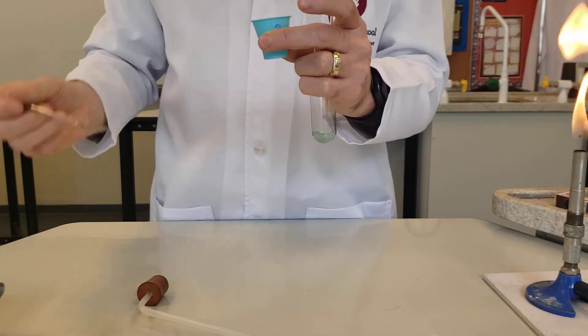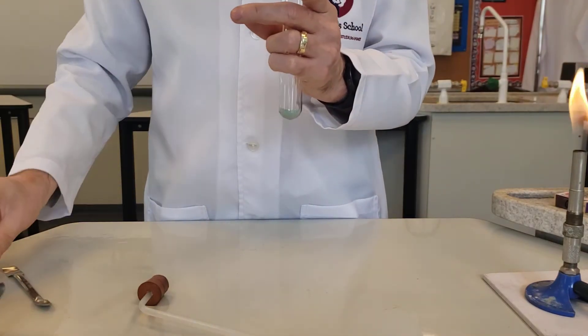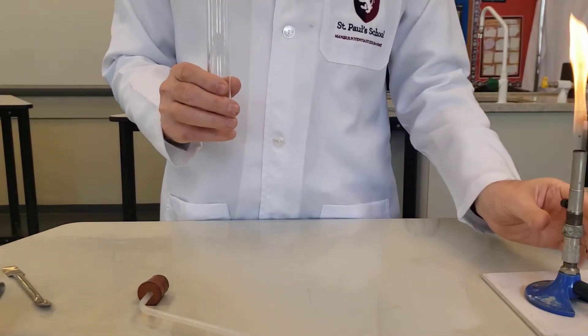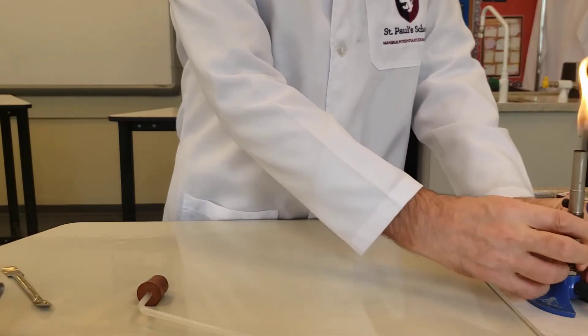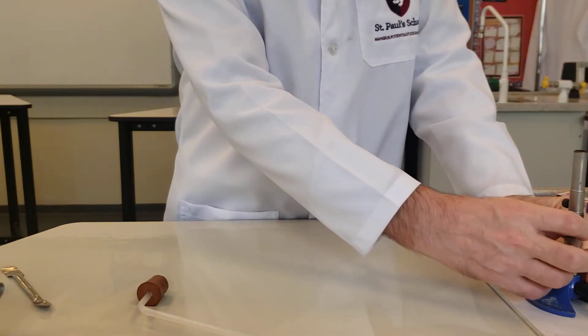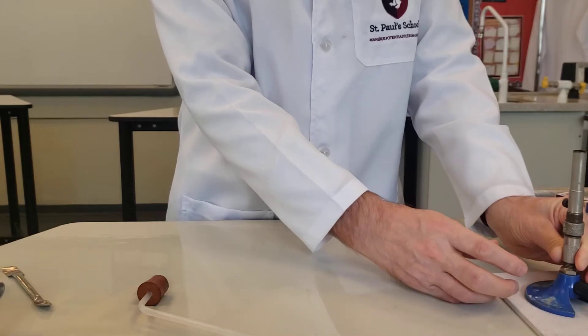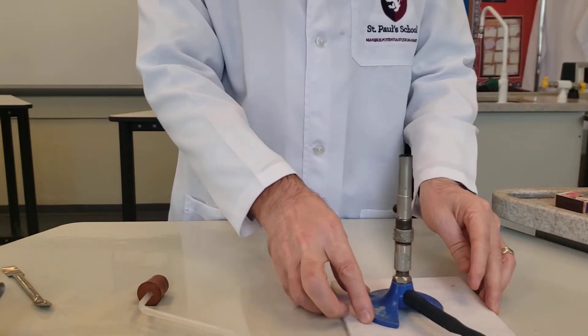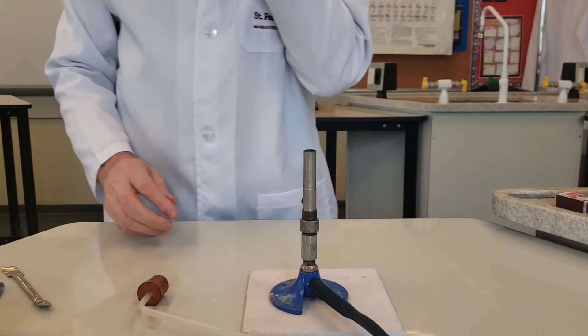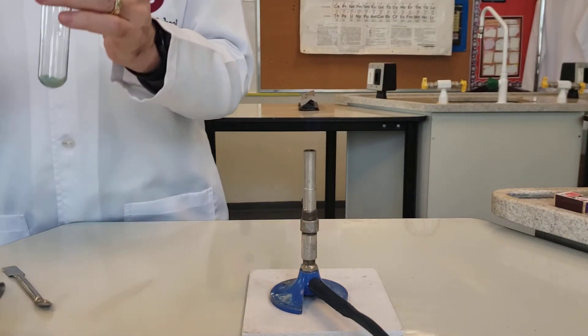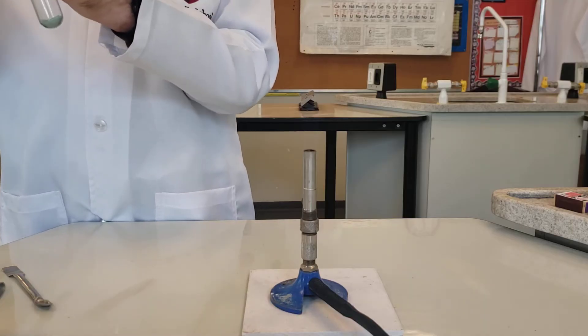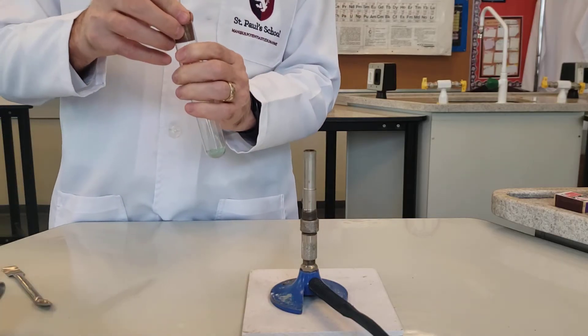And I'm going to heat it gently in a small blue Bunsen flame. So gentle heat, not strong heating. And while I'm doing the heating, I'm going to pass any gas that may form into lime water.